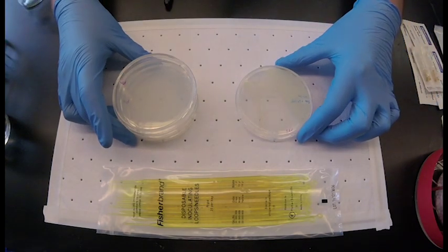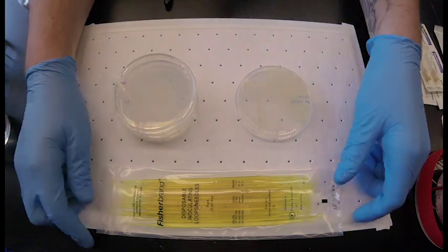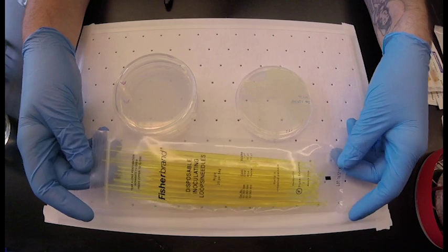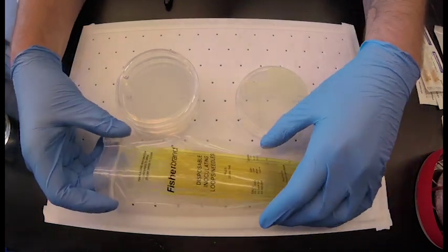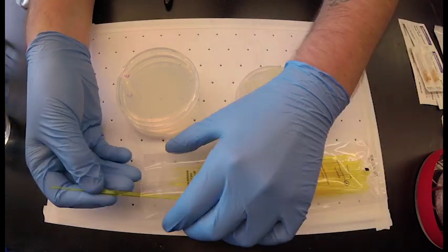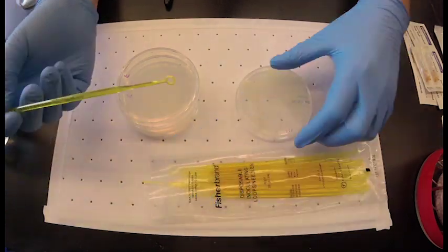To do this with live bacteria, take a pre-grown plate and pick a single colony with a sterile loop. We use disposable sterilized loops because of the methane in our laboratory.